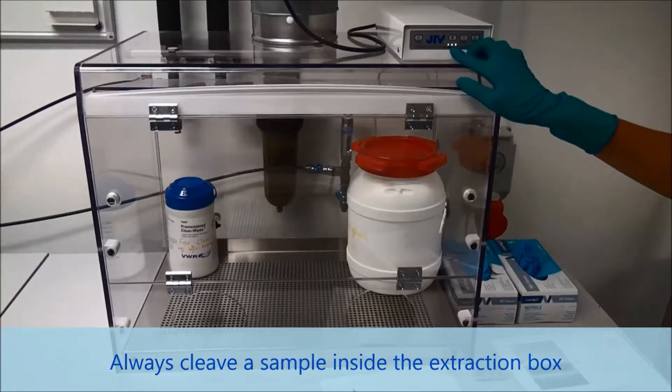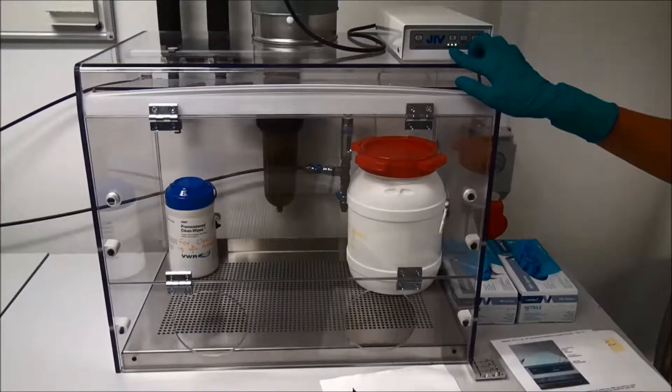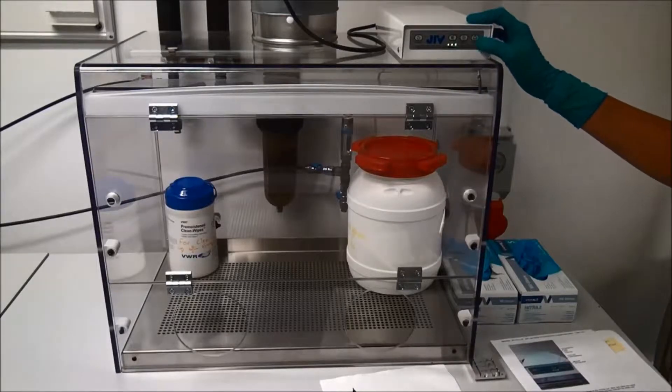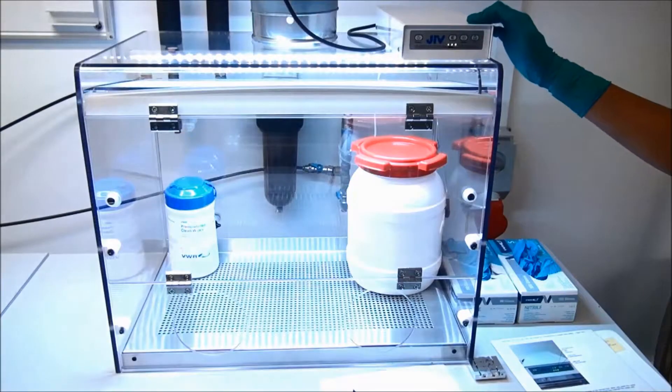You can look at the LED light over here to see if the machine is on. The light can turn on by placing this one here.